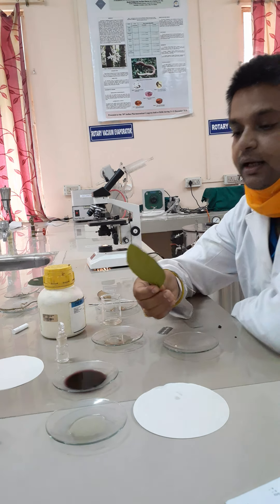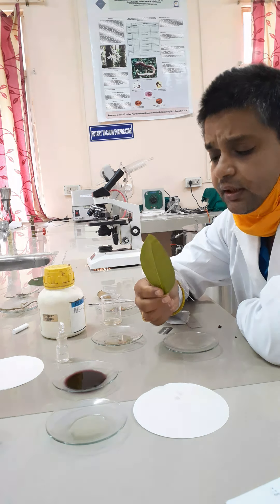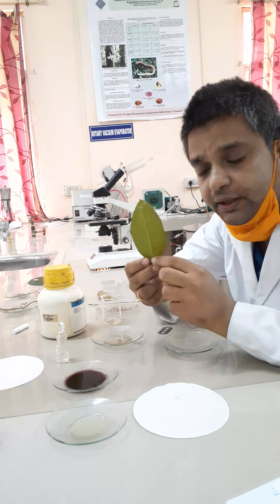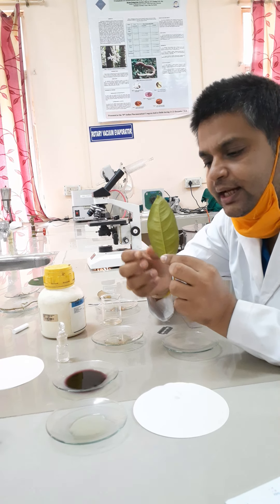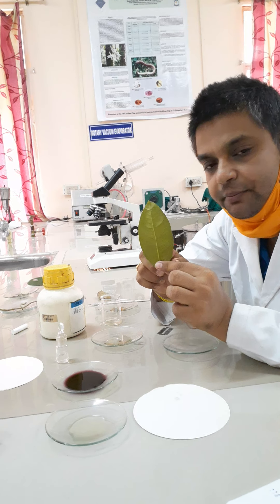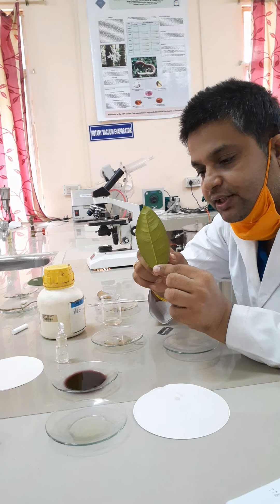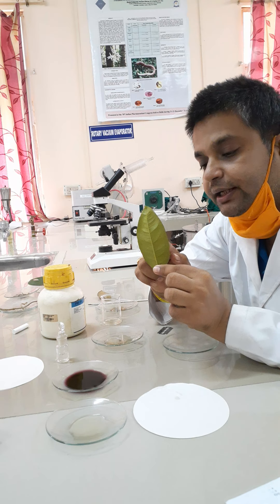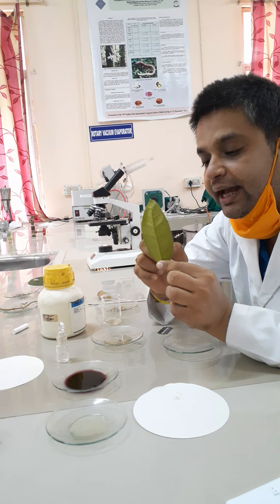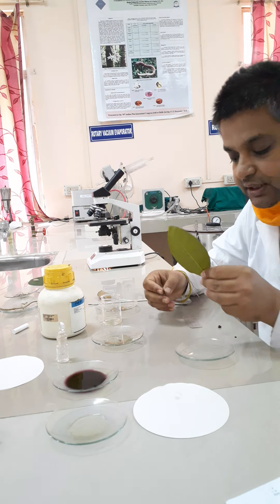This is a typical part of a very small leaf. You can see at the center part, the midrib is present, and the two parts on either side of the midrib are known as the lamina. We have to take a section in such a way that it contains both the midrib and the lamina part.